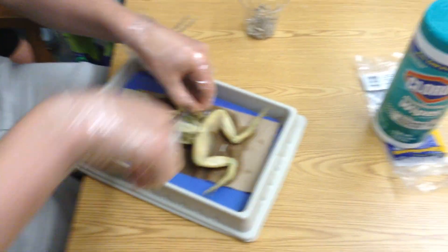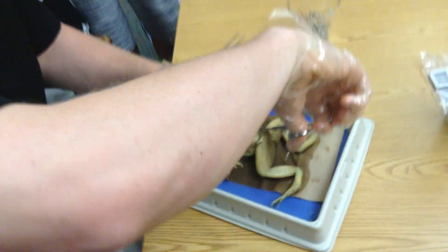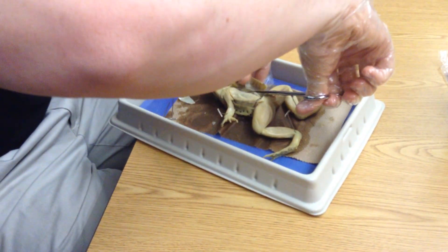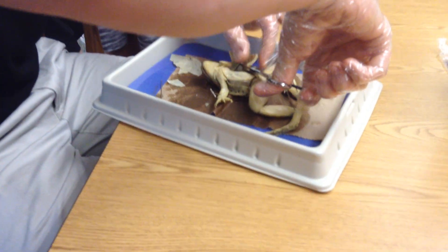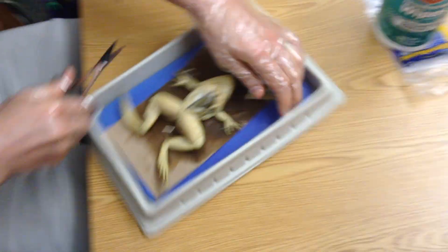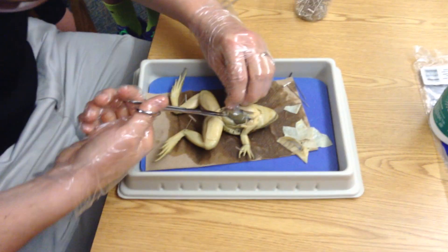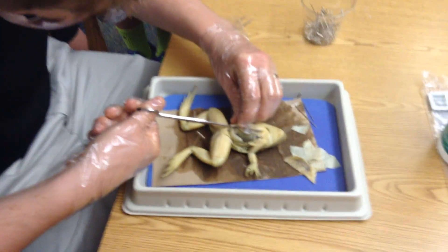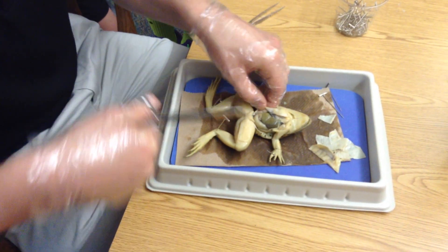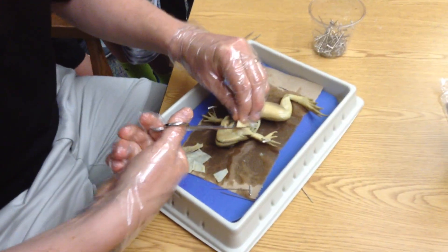You'll notice it's not as red as they made it look in the app — that's so cool. I want to get this just out of here completely, so I'm going to cut this muscle off as well — without cutting my glove, hopefully. It's like gray. Yeah, it's gray — I think I told you guys a lot of it would be gray. It's not as pretty bright red as they make it look, that's for sure.